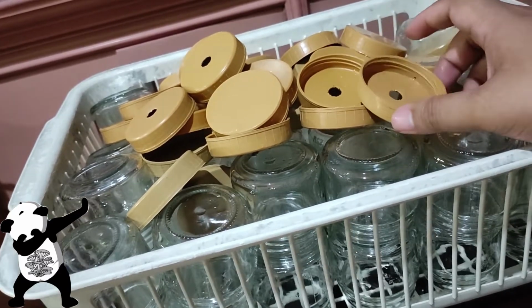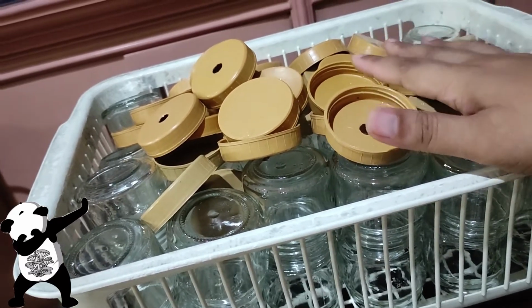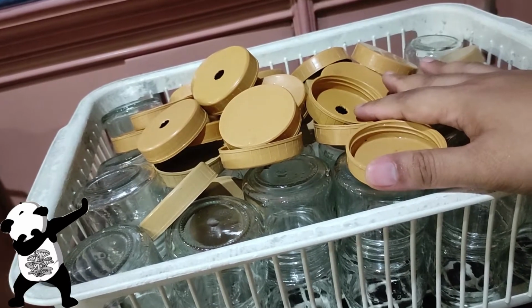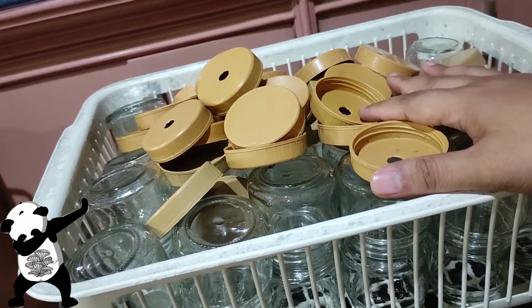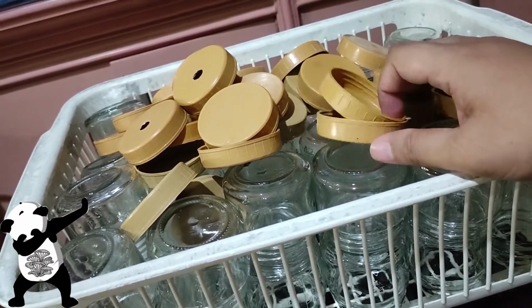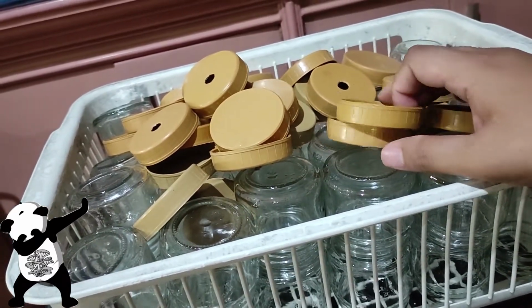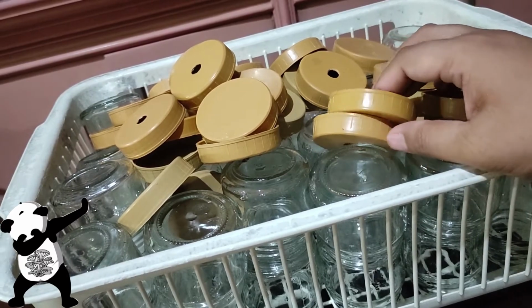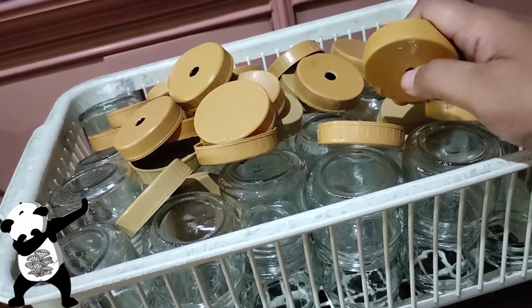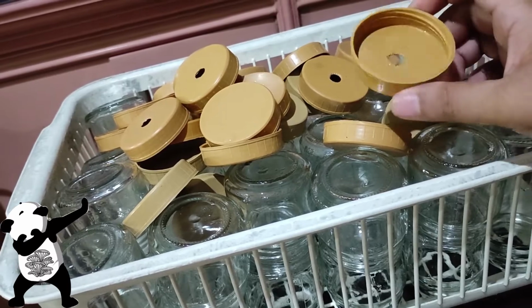already dead. And I didn't soak them for just 3 hours because I was not at home yesterday, so probably one day. I believe I did coat them with vinegar for one day, and that's okay because what we want is to really kill the molds, even the previous mycelium, so that they won't create another issue on the next batch, and hopefully it does the trick.